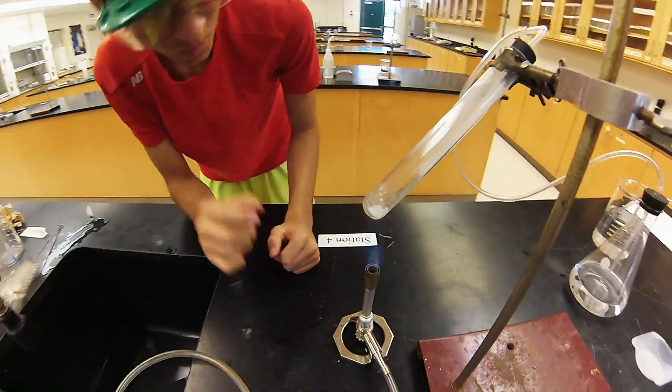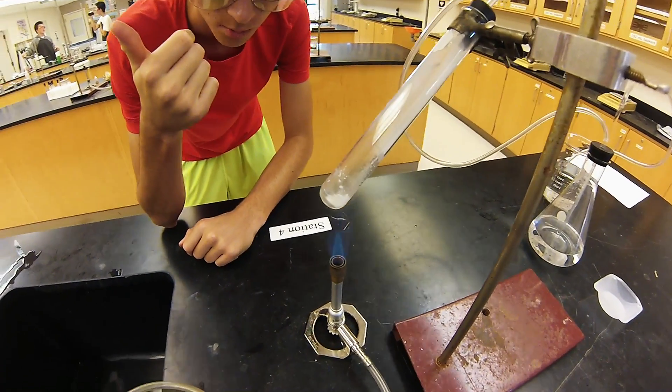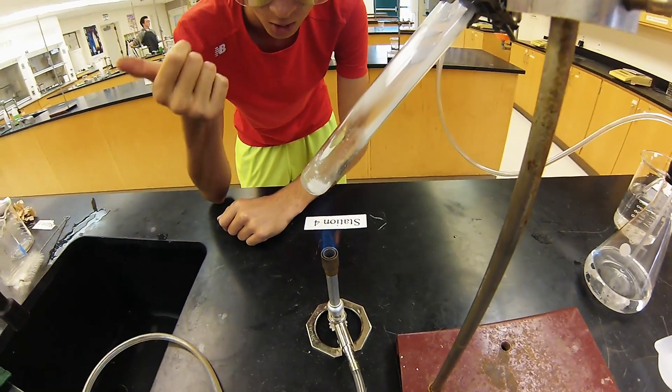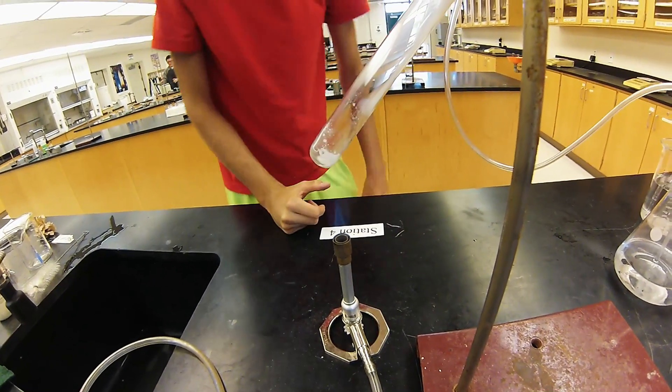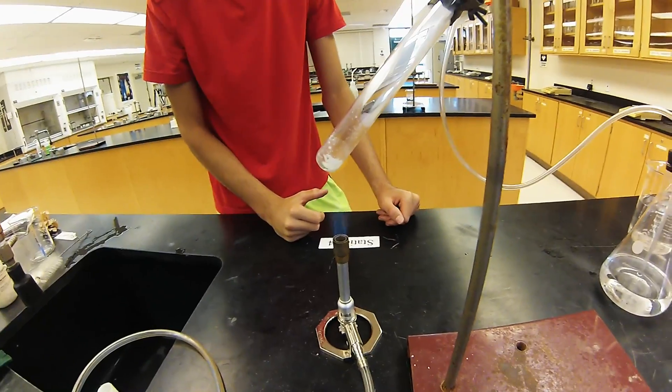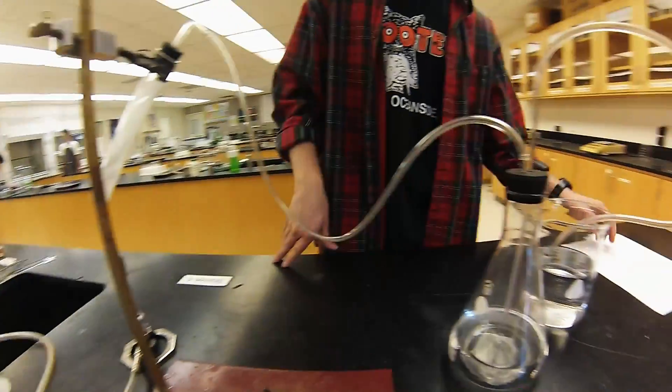As you can see, the solid that was in there has now been replaced by this hard crusty solid. And now not much gas is being produced. We're going to let the system cool for about five minutes.